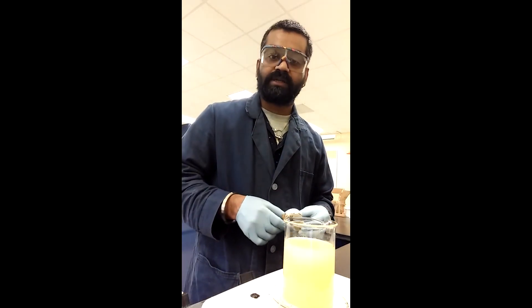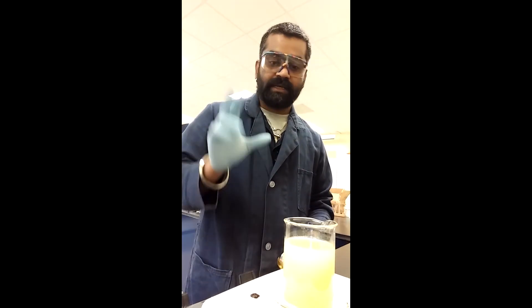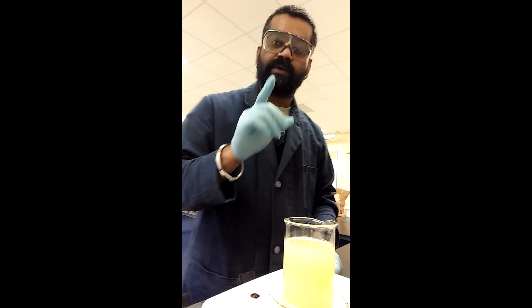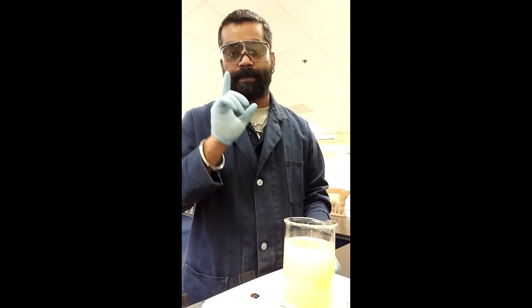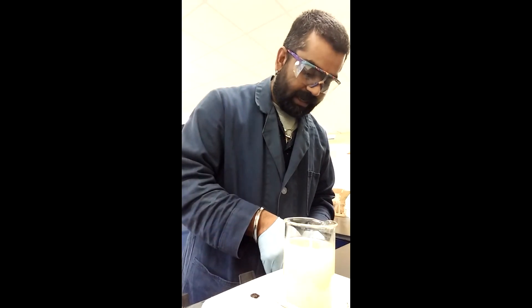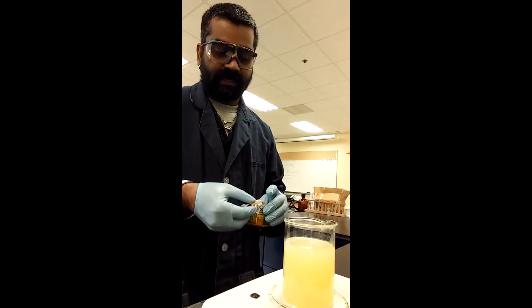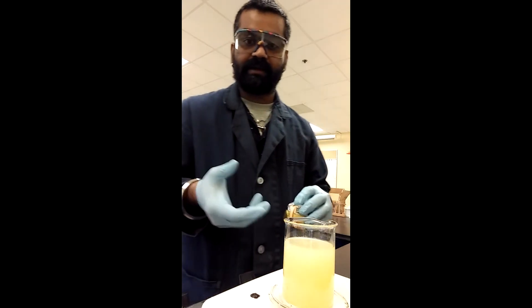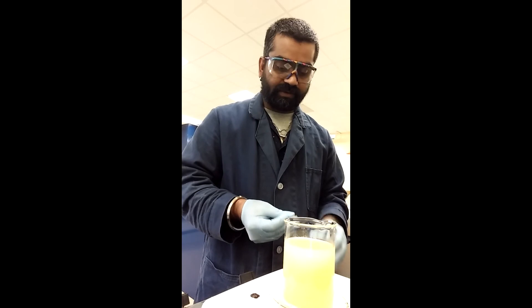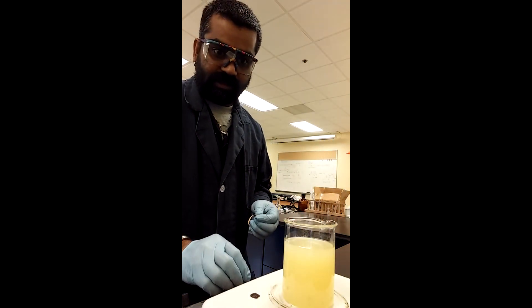Essentially you're trying to convert the citric acid into the salt of citric acid. For those of you thinking you've heard this somewhere — it's the word that starts with the letter B as in boy. That's what we're trying to do here — making a buffer. Don't keep dipping the same paper back and forth again and again; keep ripping off a new piece. For those of you that need that extra bit of help, I'm going to go ahead and start the stirring here.